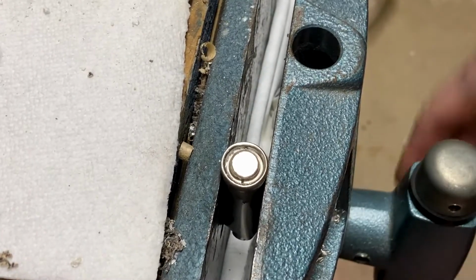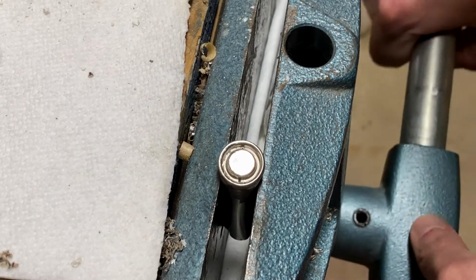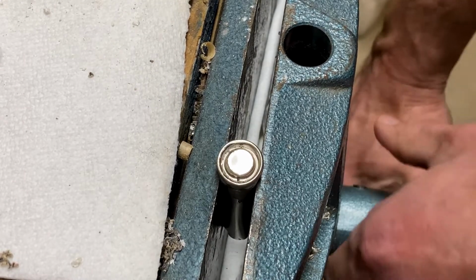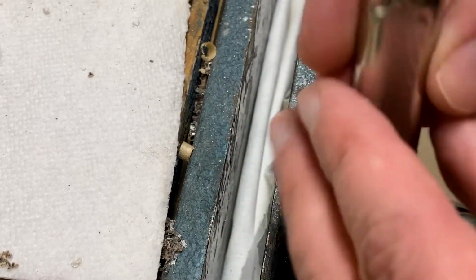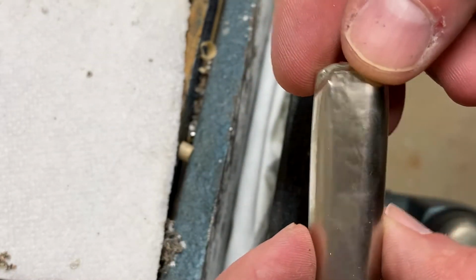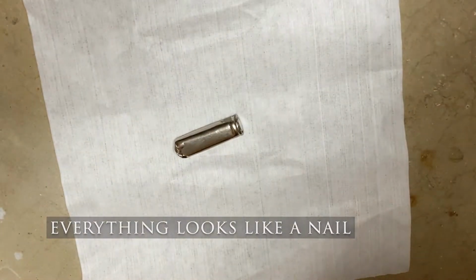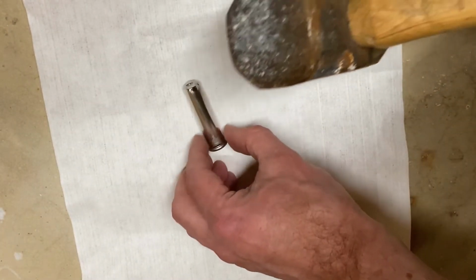See if that makes any difference. Maybe soften this up enough. It's probably the electrolytes inside that are causing issues with this. All right. Well, guess that's not really doing anything. I mean, it's getting mashed down nicely, but not much else. I might have to move on to trying to use the hammer on it. Well, that's what we're going to give a try. And if we're going to do a hammer, might as well do a big one. Let's see what happens.